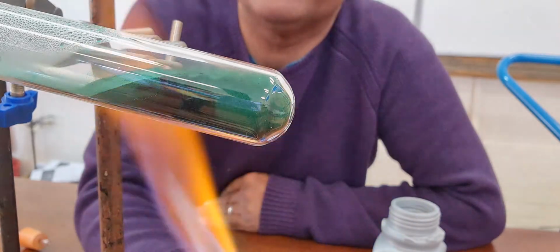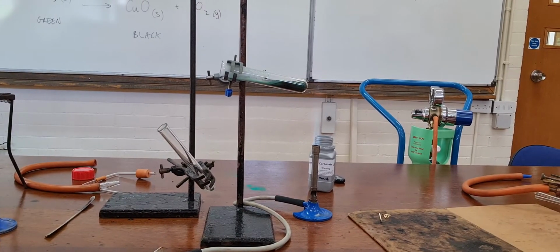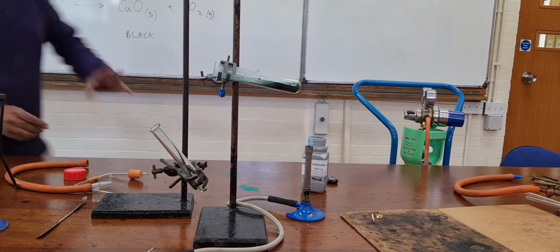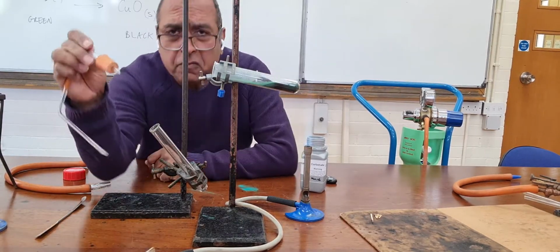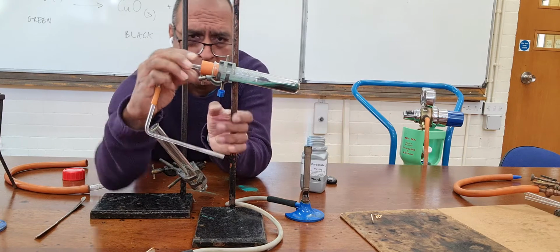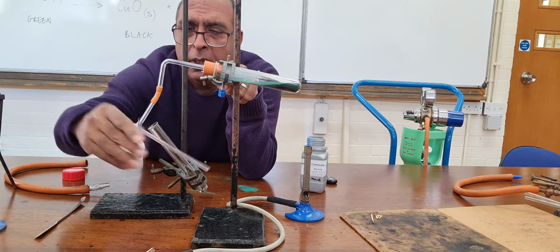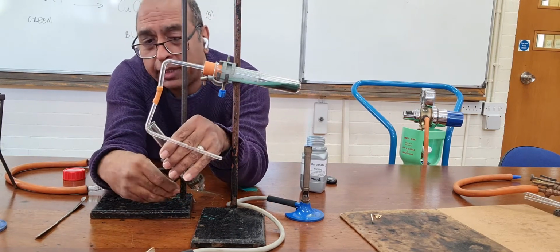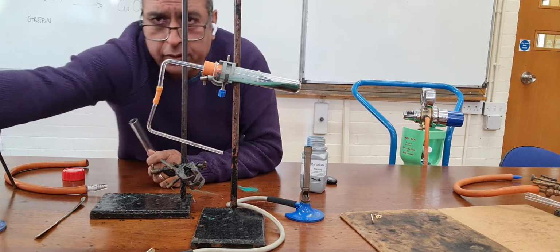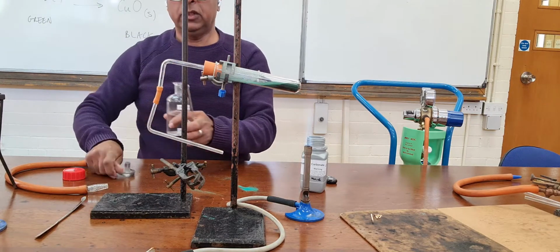Now, it would be good to collect the gas coming up. So, put you back there. Because my wonderful technicians have made some apparatus, which I'm going to put in there. And so any gas coming off will be forced to go down this tube. And to prove to you it's carbon dioxide, you should know already that the proof of carbon dioxide is to shake with lime water. So I'm going to put some lime water in here.